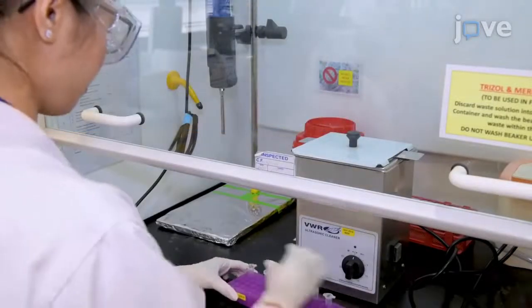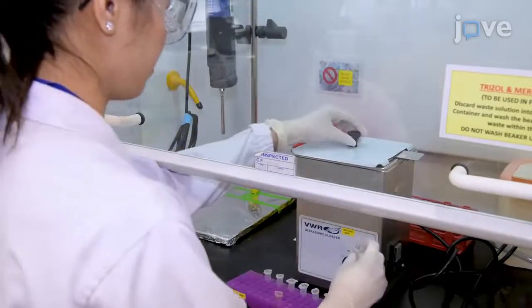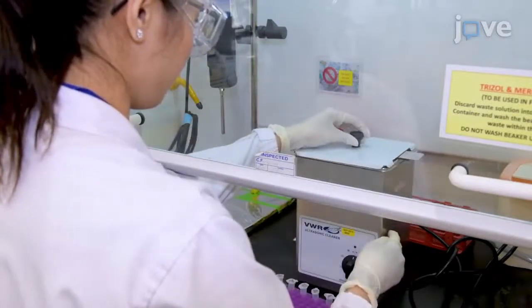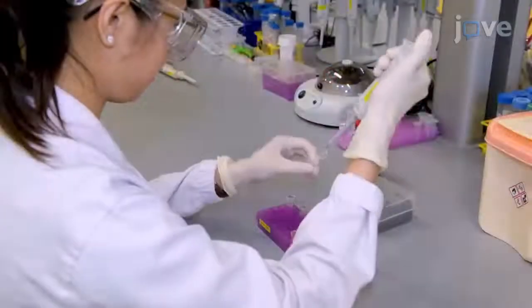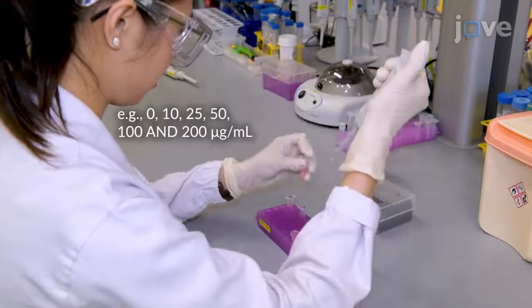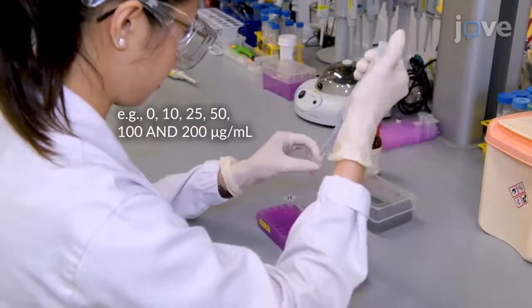To begin, place an Eppendorf tube containing zinc oxide nanoparticles in zinc oxide nanoparticle stock solution into a sonicator for 15 minutes. Prepare zinc oxide nanoparticles at various concentrations using 1 mg per milliliter zinc oxide nanoparticle stock.